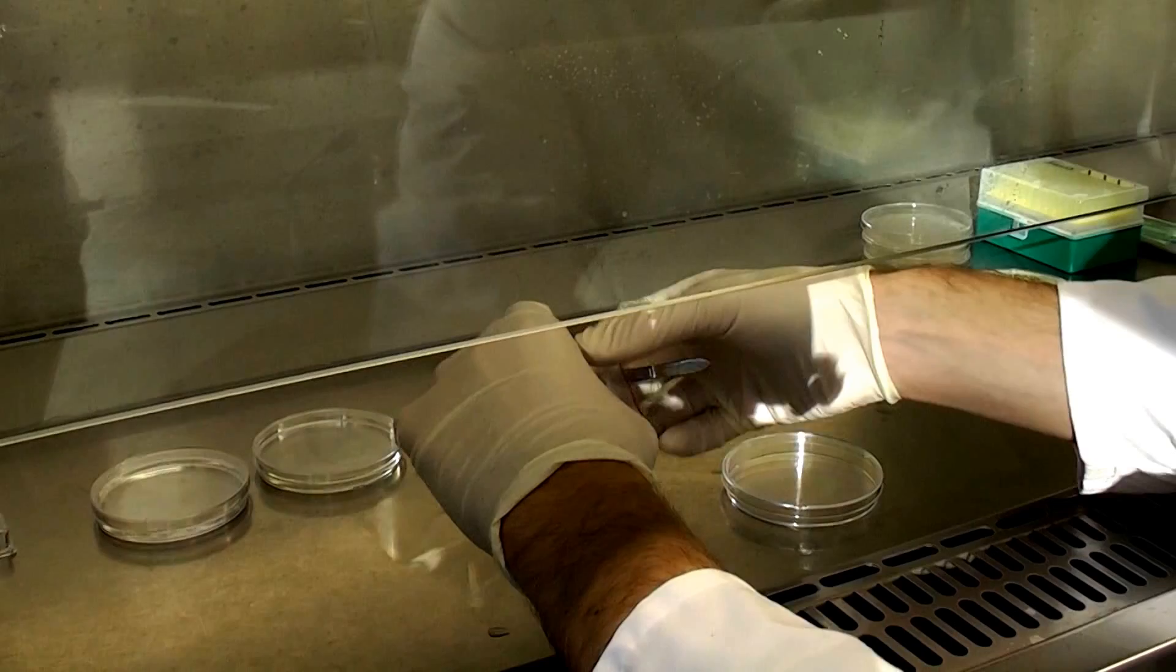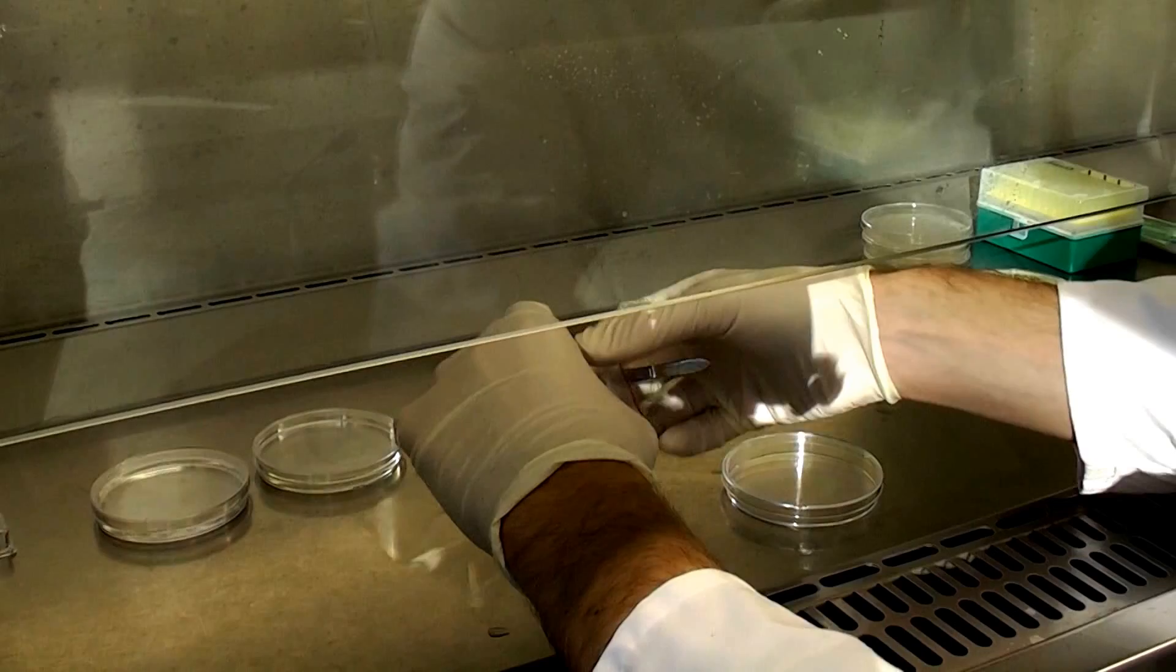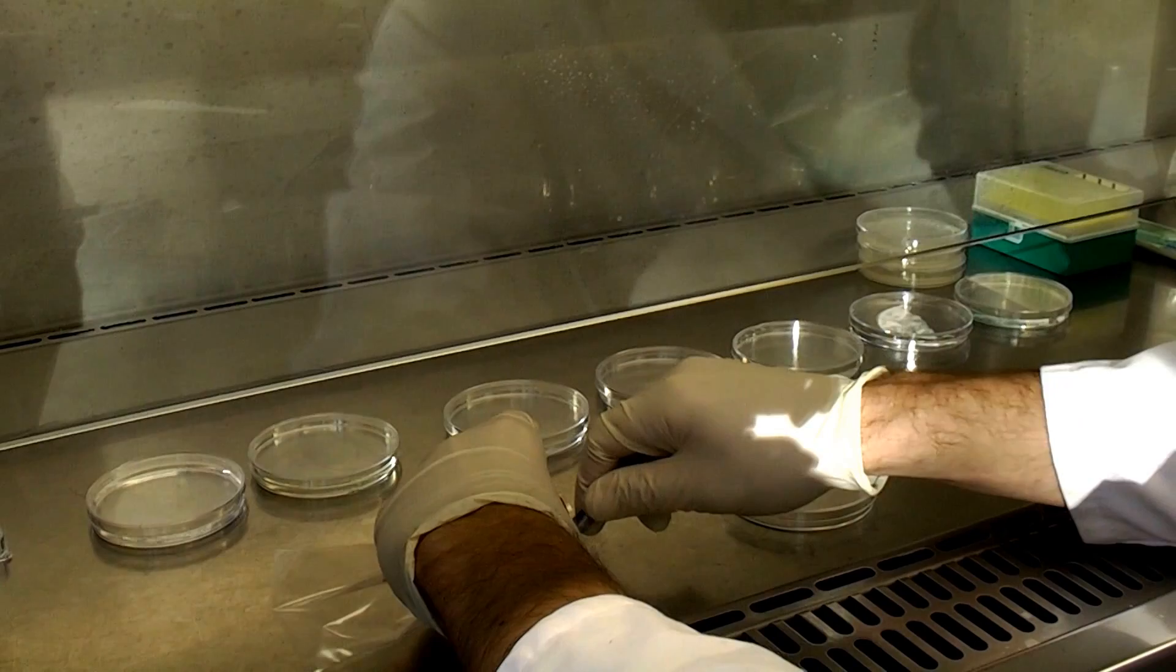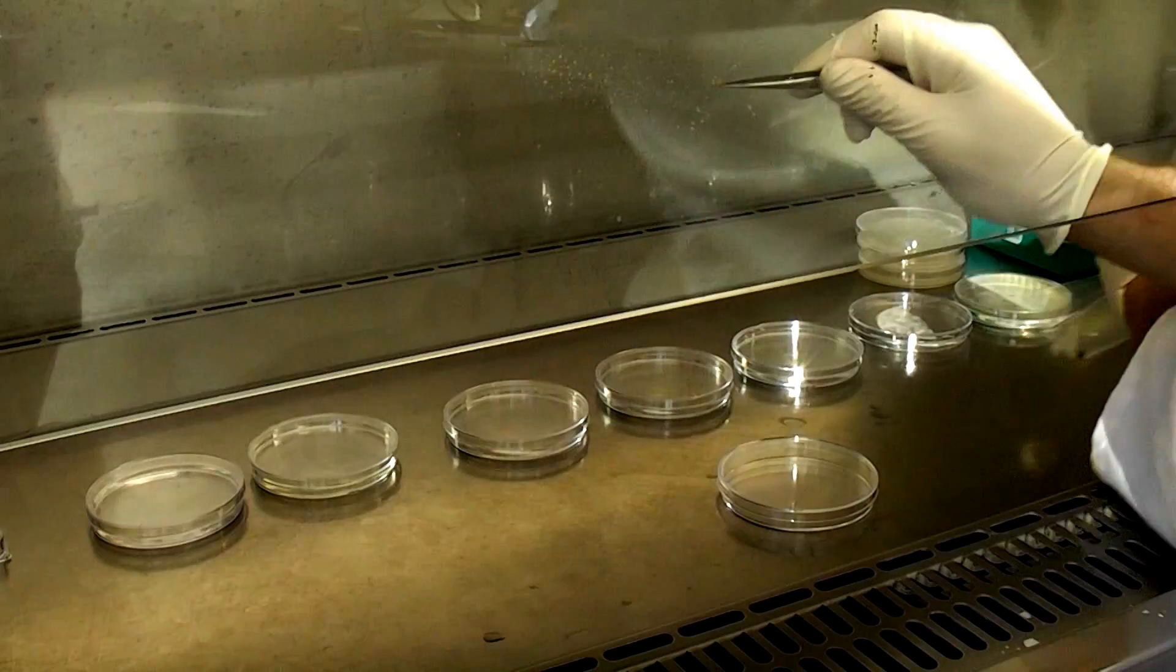So I'll just take my forceps and sterile ones. So you see what I've got there is a nodule off one of the plants. So now I'm going to open up my different petri dishes here.